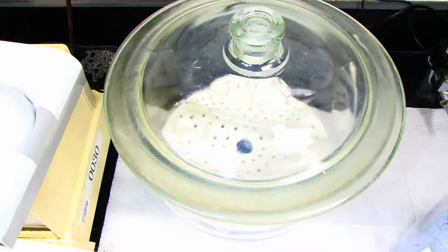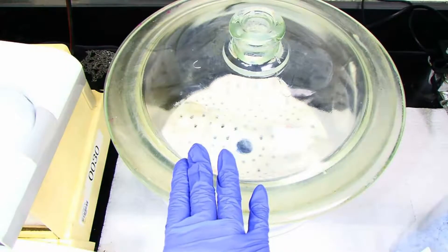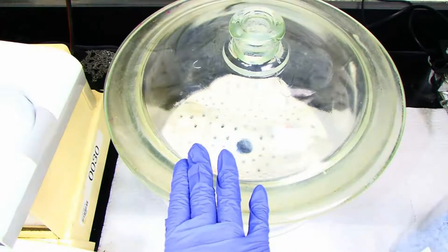A day or two before the lab, you will place your clean air dried glassware in a hot oven. Then your professor will remove it before lab and cool it in a desiccator. The desiccator has Drierite in it to keep the atmosphere dry.